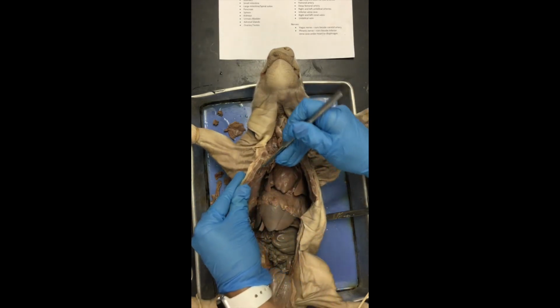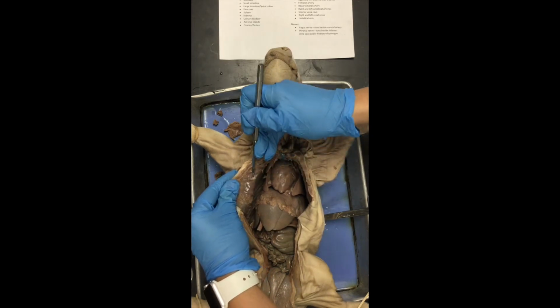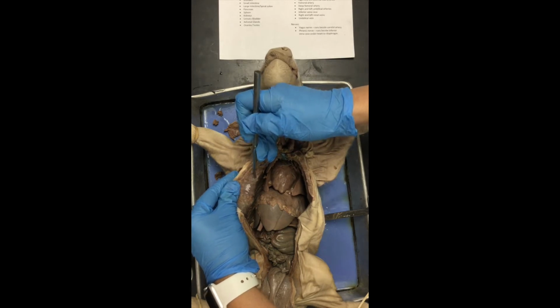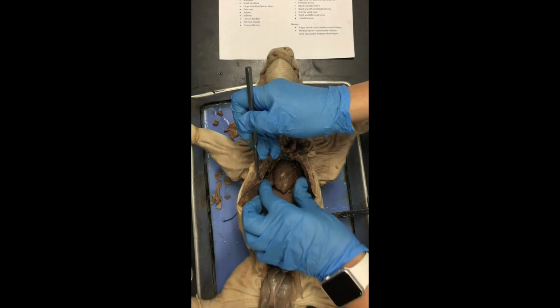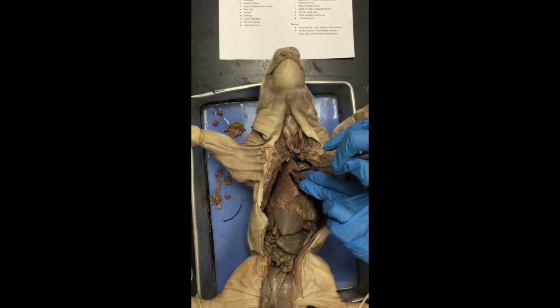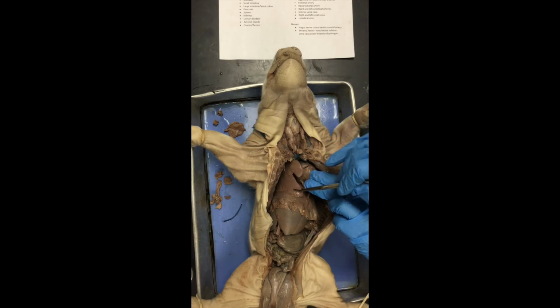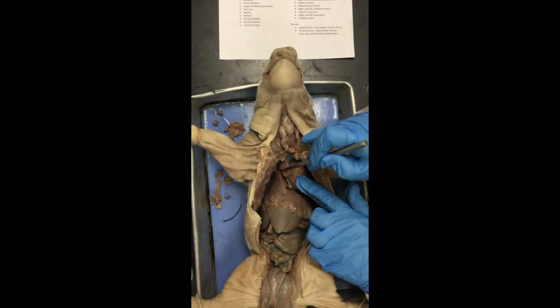We cut through the parietal layer, and if I keep digging a little bit here in the thoracic cage, you can see it right here. I can peel it away from the inner portion of the ribs, the deep portion of the ribs. This is known as the parietal pleura. Parietal pleura. There's also a visceral pleura on the surface of the lungs. Now, we can't really peel it off because it's part of the lung itself. So we just say that the visceral pleura lies on the surface of the lung, and this is what gives it that shiny appearance that we see. So parietal pleura on the wall, visceral pleura on the lung.